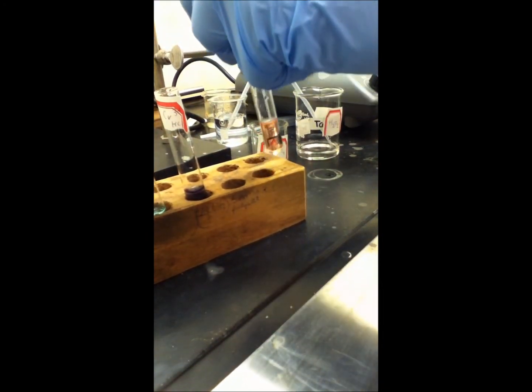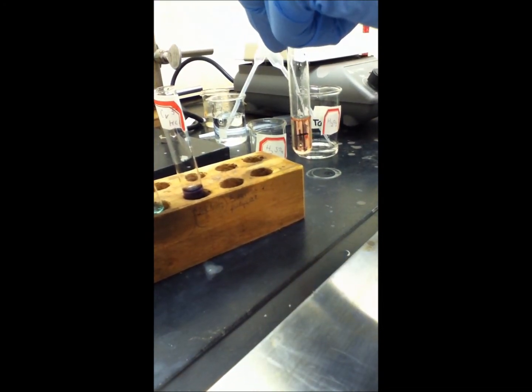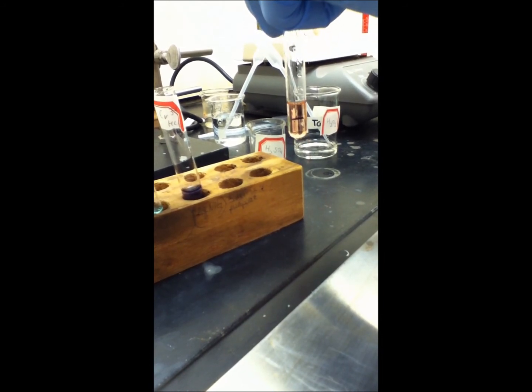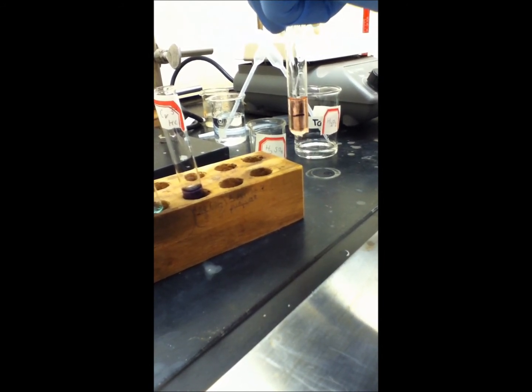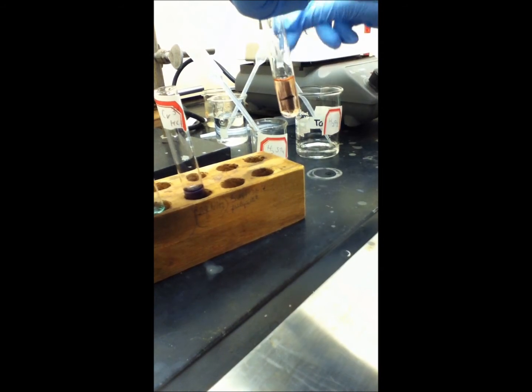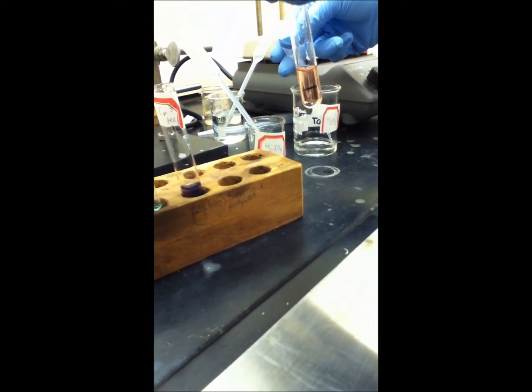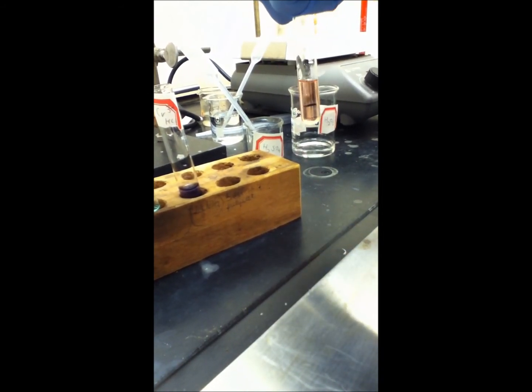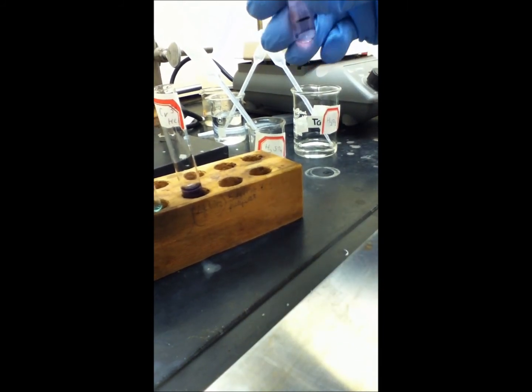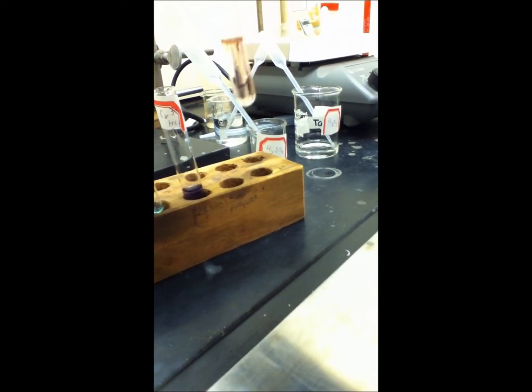Finally, we have a cobalt solution, which we're adding five drops of sulfuric acid to. Then we're adding one milliliter of 30% hydrogen peroxide. And again, no changes occurred.